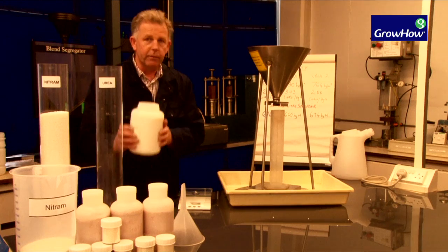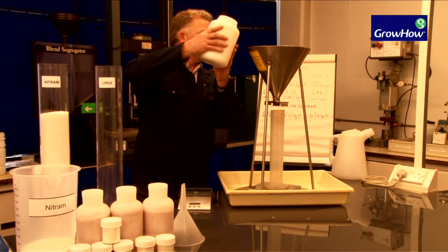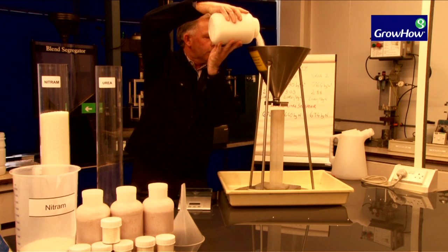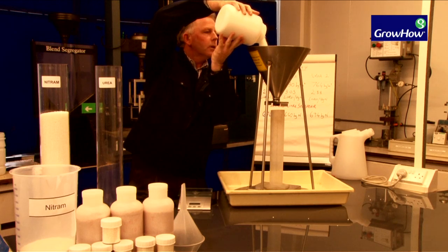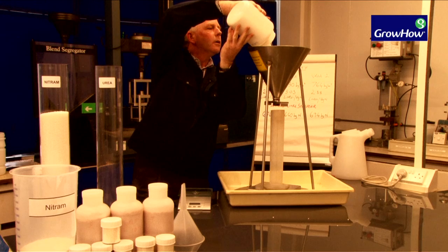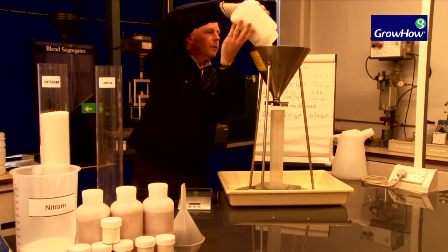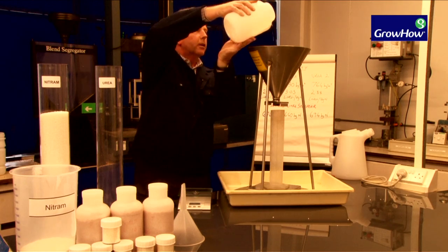Here I have the first sample of urea that we used, so I'll tip enough in there to fill the cylinder.